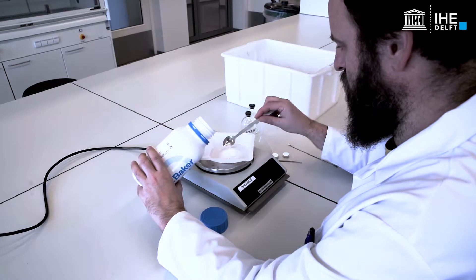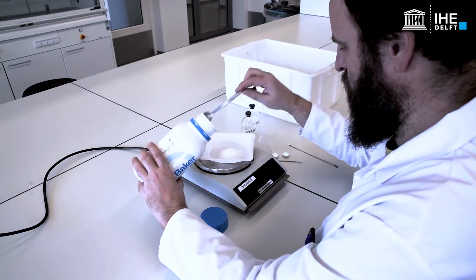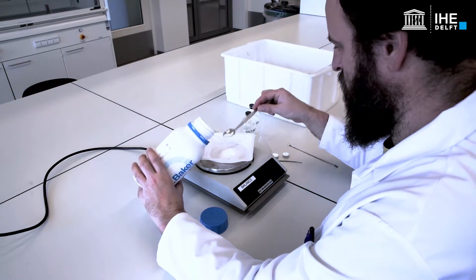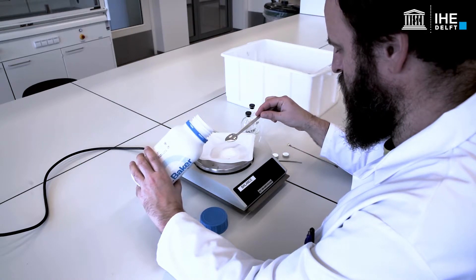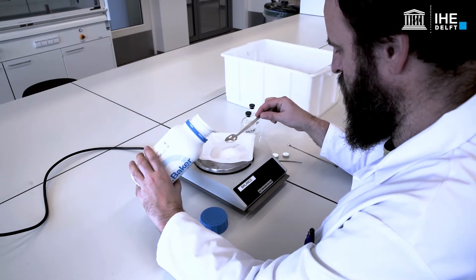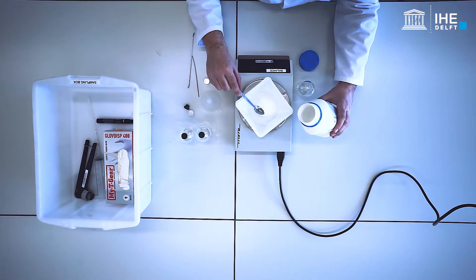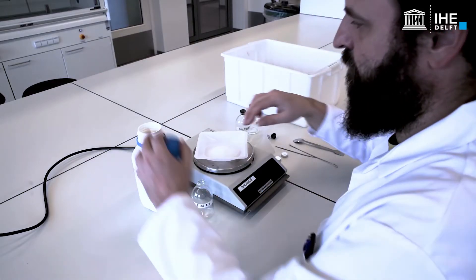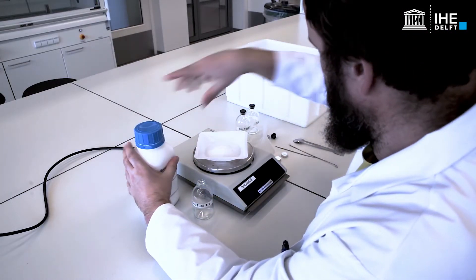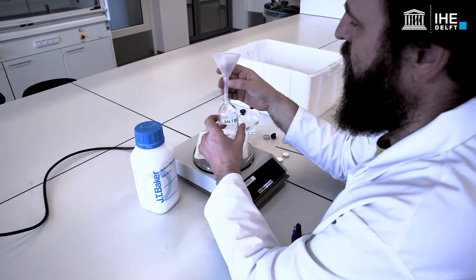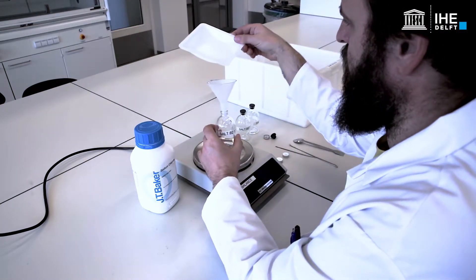Also, gather all the required materials for the collection of wastewater samples in the field. A funnel can be used to pour the salt into the serum bottle.